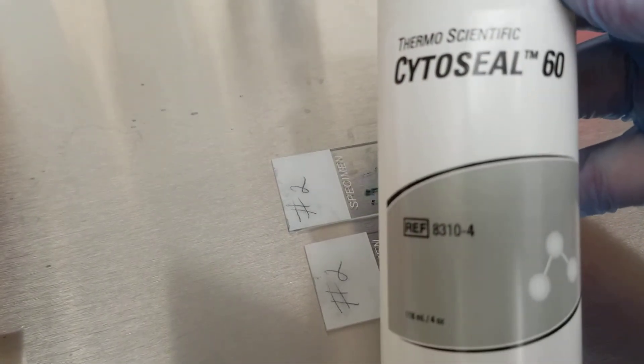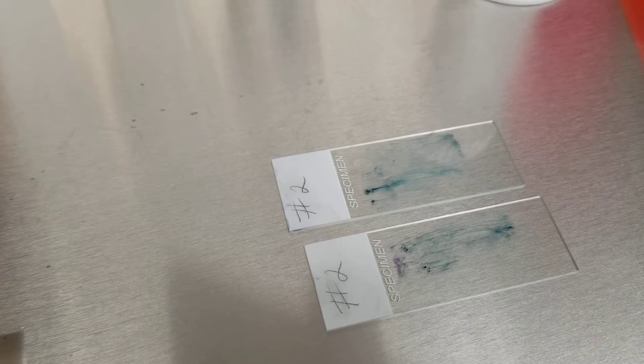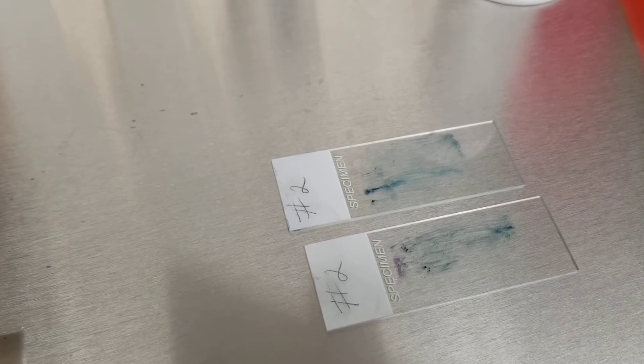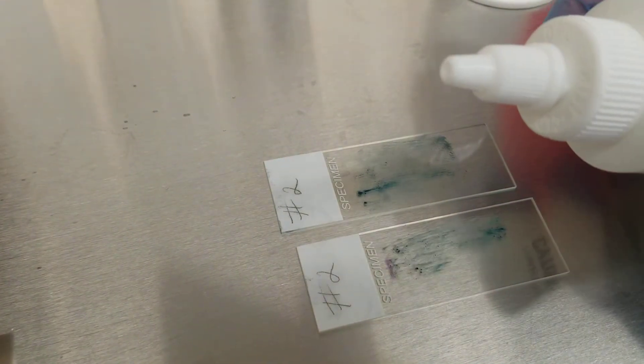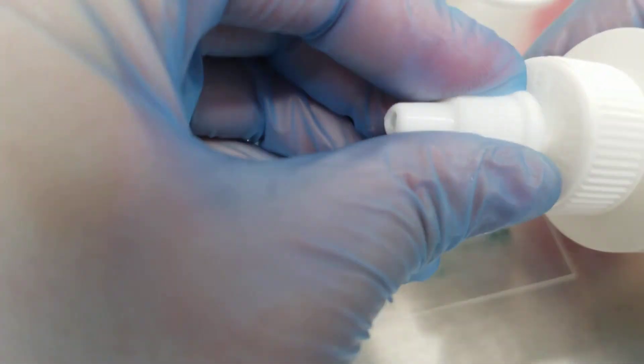What we're going to use today is mounting media. This is Cytoseal and you should be using it in the hood because it does have a lot of vapors. Don't ever leave it all the way open. You have to open this. This is closed right now and then you open it to perform the mounting technique of the coverslip.